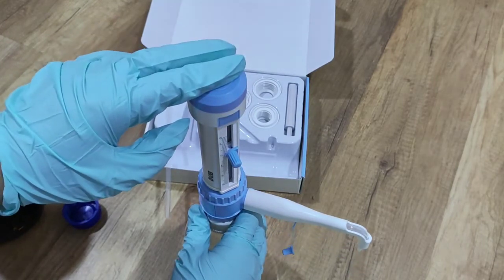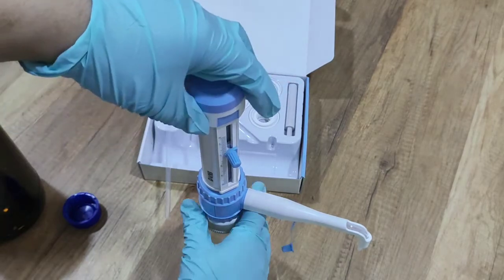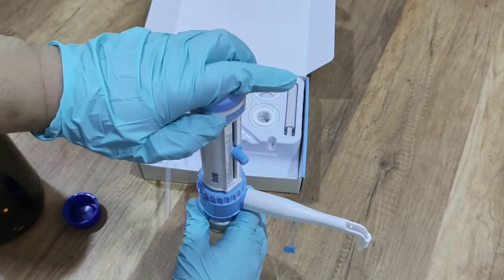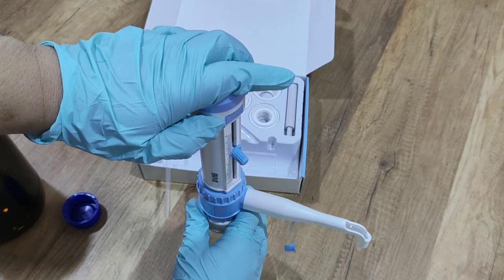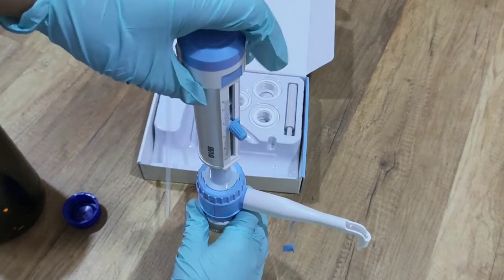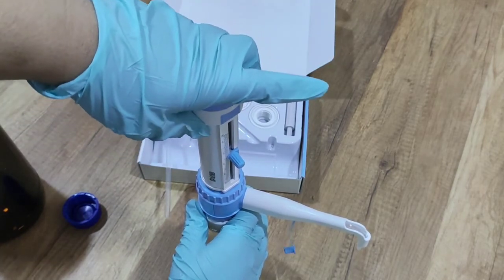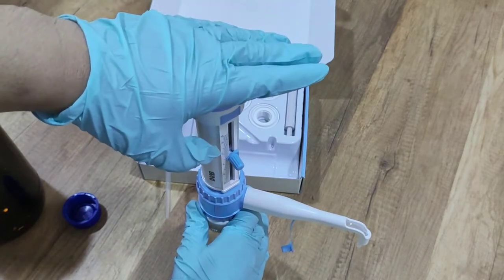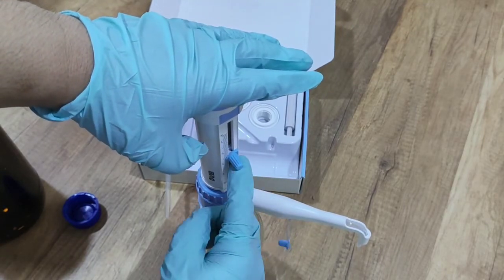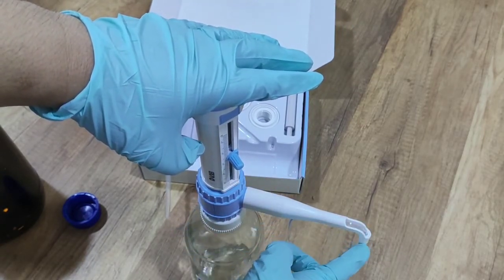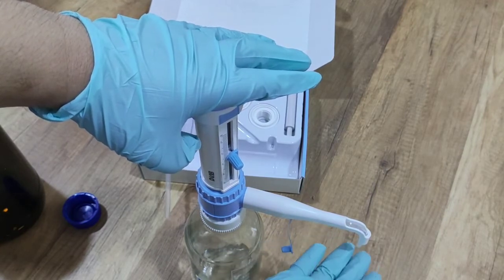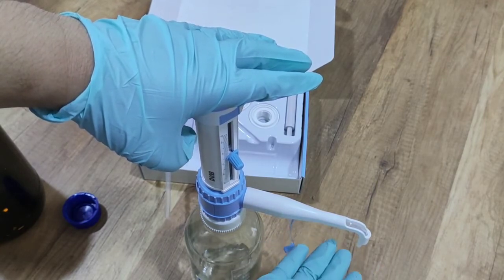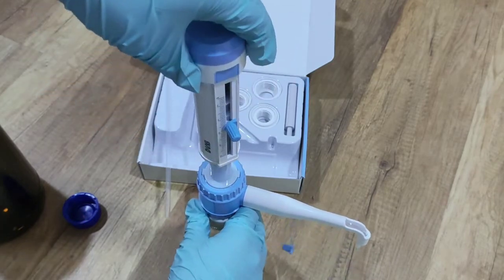And we're trying to manipulate how to dispense. Once we set up the volume we want, then we just pull up this one and push down fastly. Pull up, push down. Pull up, push down. Pull up. Then the volume that we set will be dispensed from the pipe to whatever container we prepared. This is the basic how it is used.